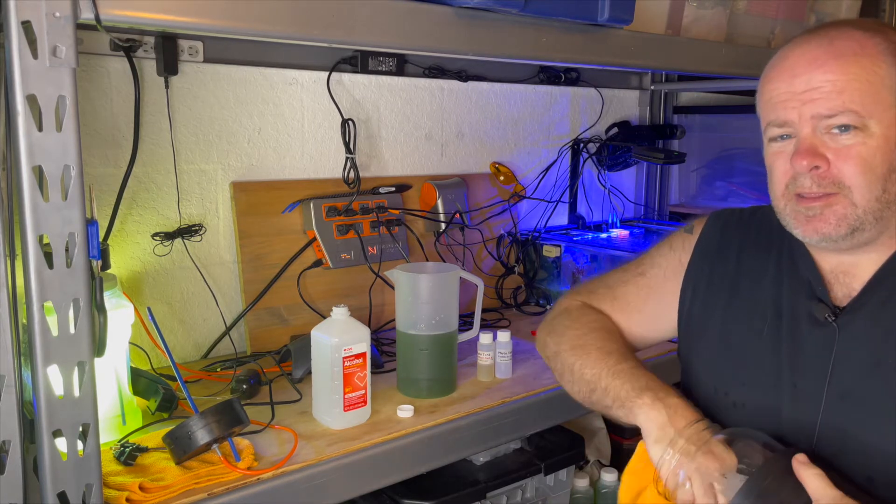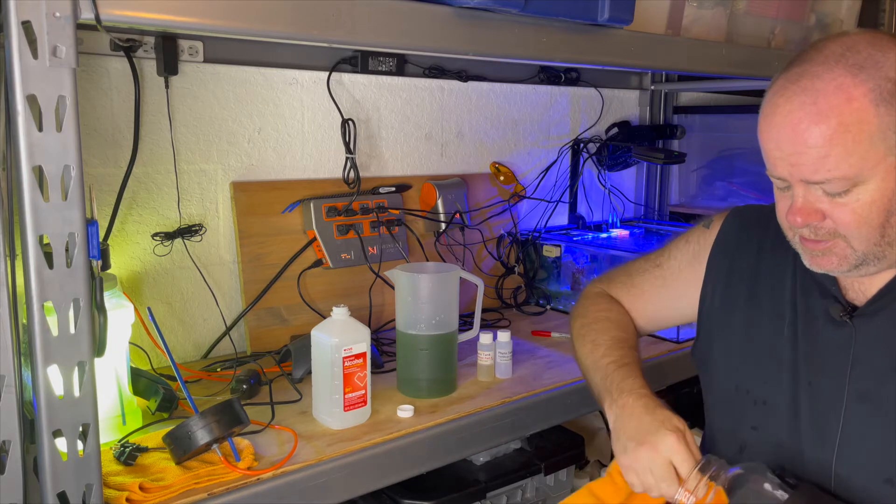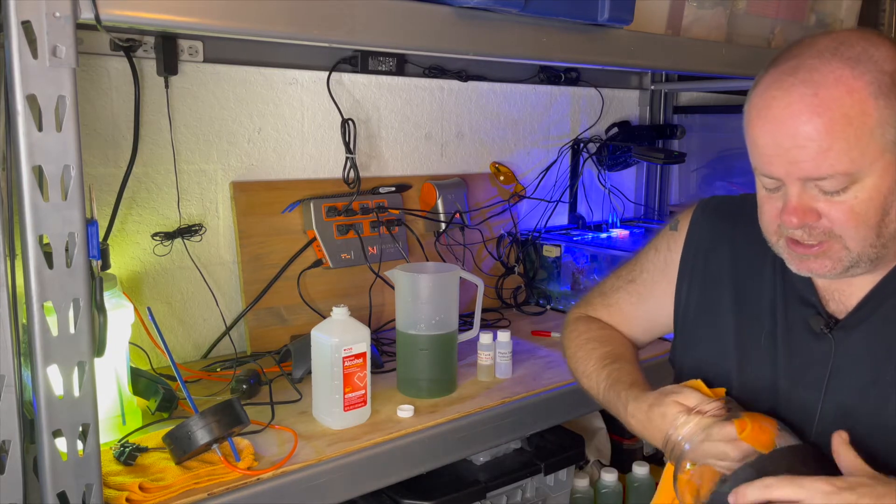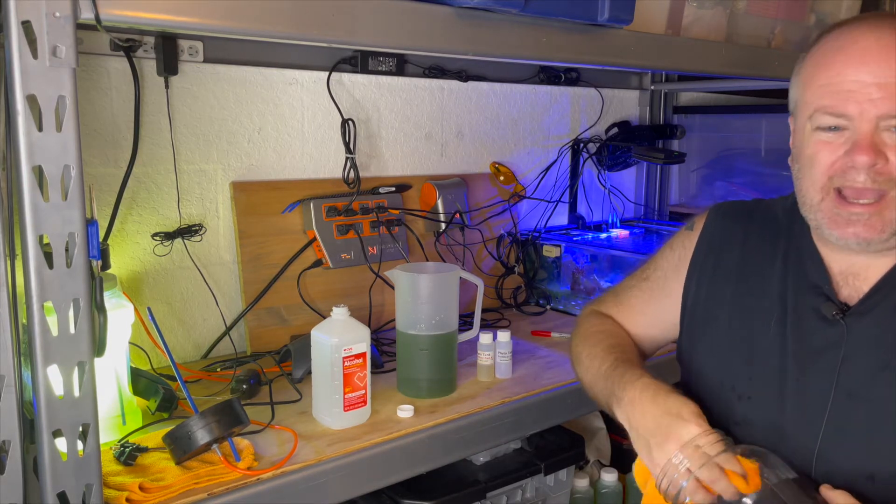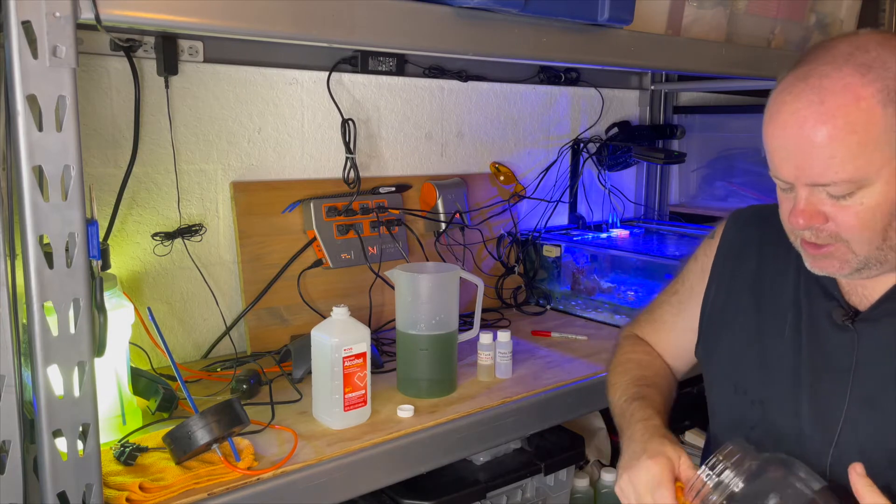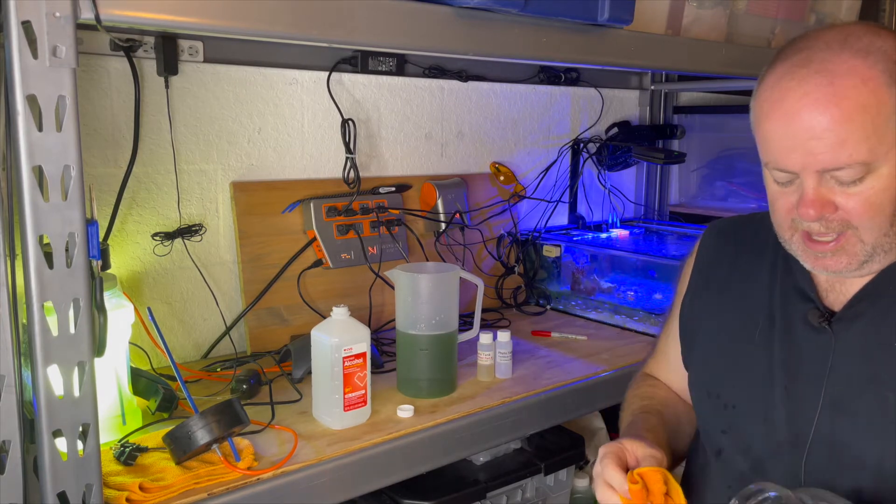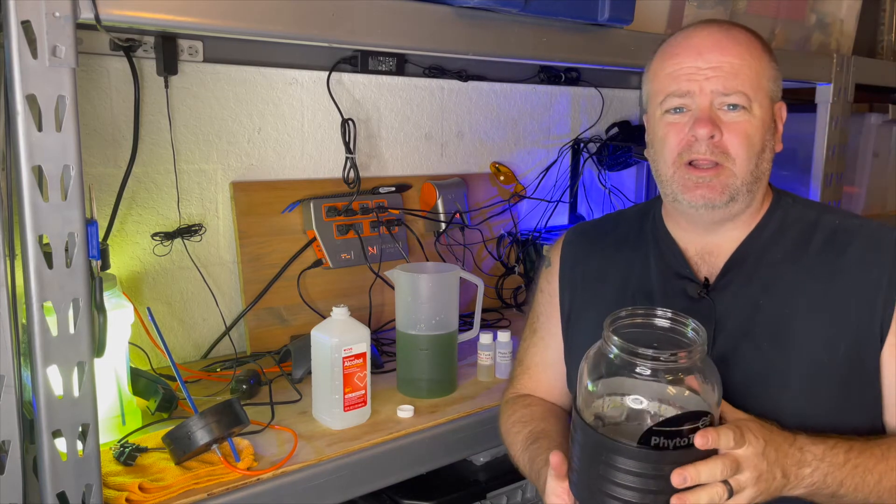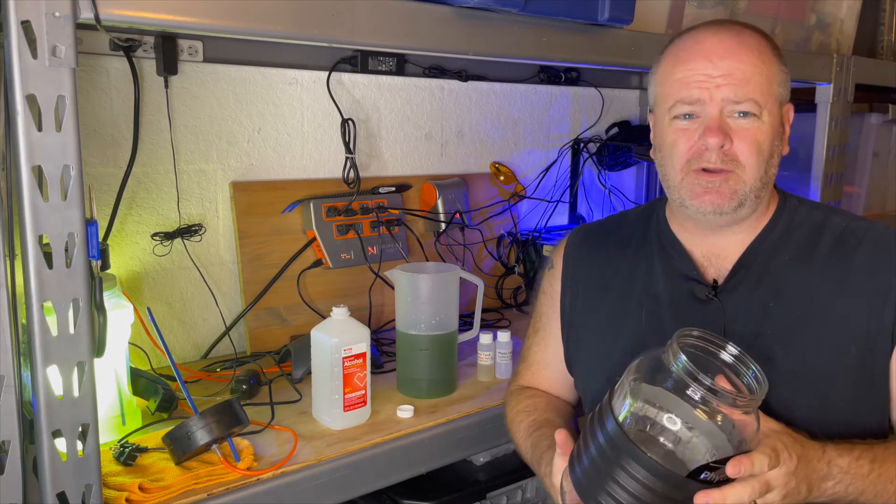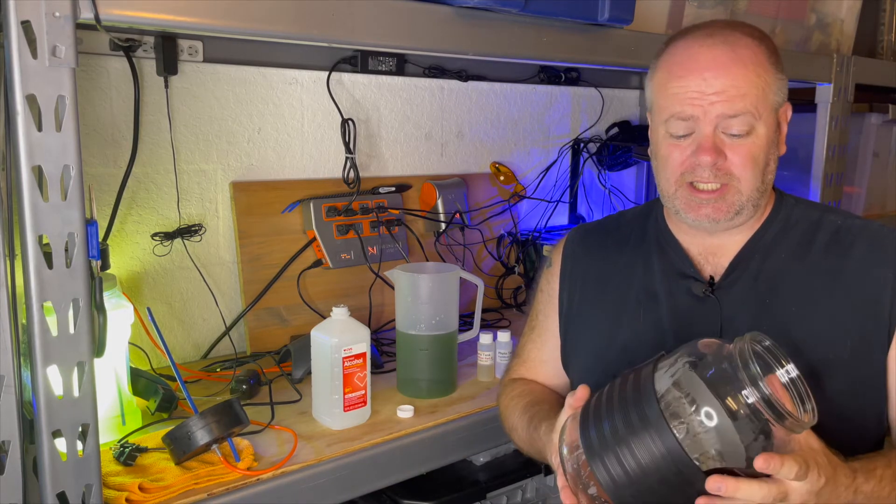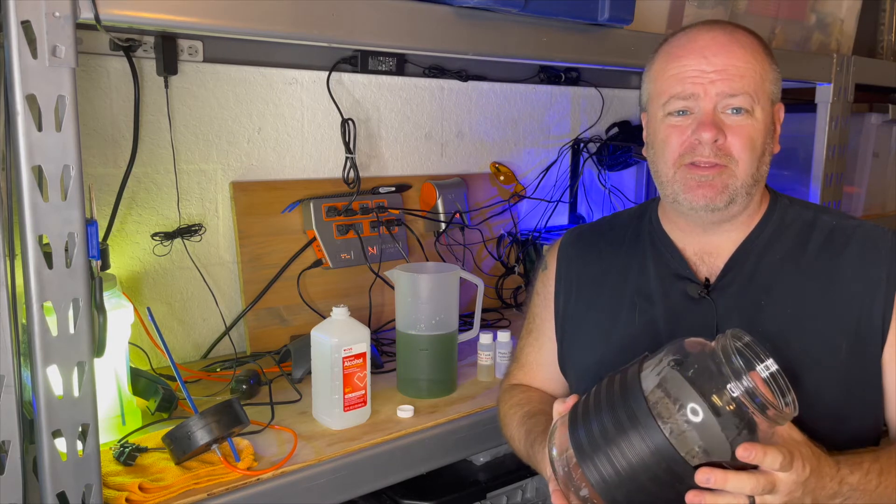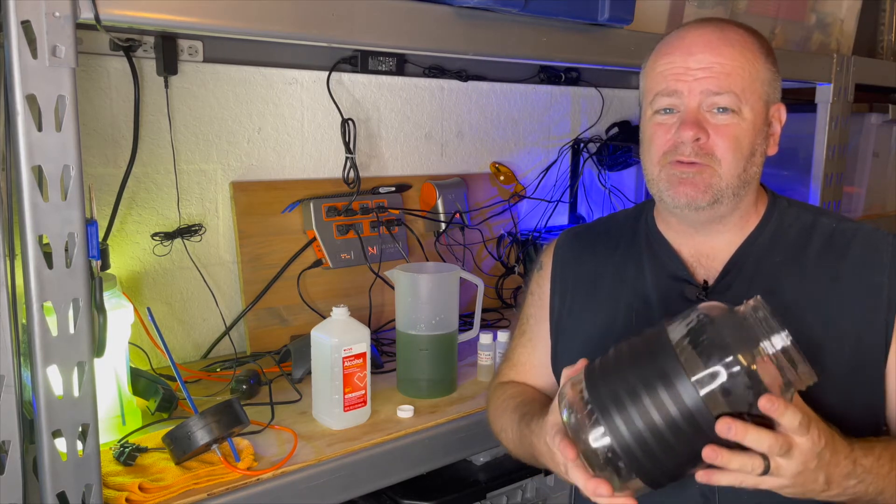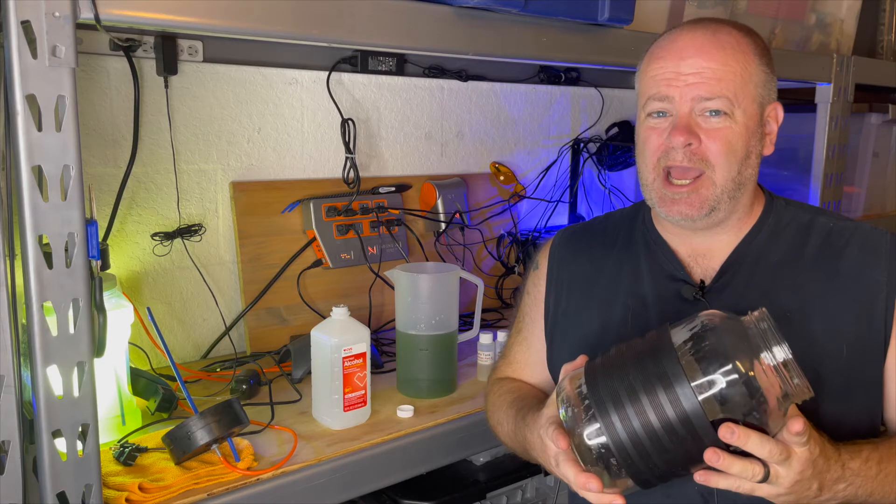Now, if you buy this particular system, it comes with bags to put inside of it. I find the bags to be a little bit of a pain in the neck. So I don't use the bags. Now, I've just used rubbing alcohol on this and I can either let it dry for a few hours or I can go take clean water, which I like to take RO/DI water and rinse it out thoroughly until I can't smell any rubbing alcohol. I'm going to go do that now.